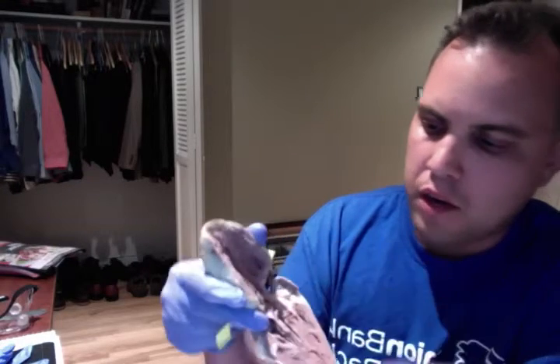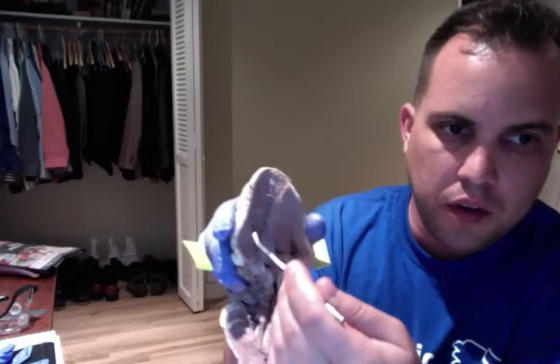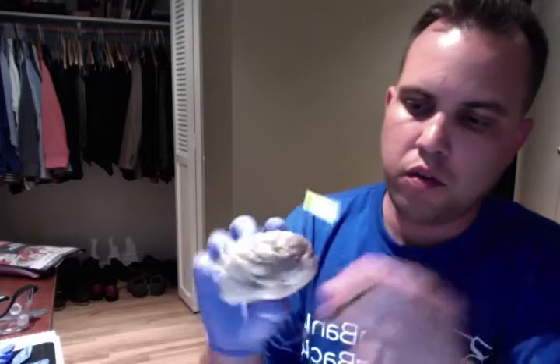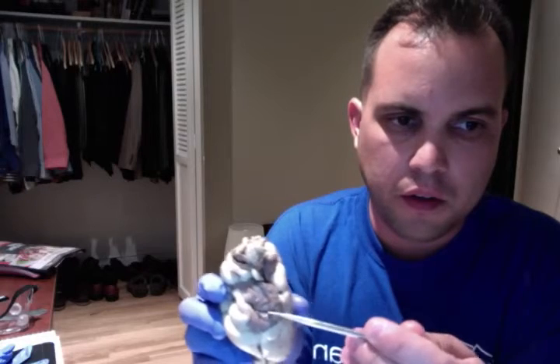And our myocardium. The myocardium is said to be pretty much most of the heart. You can see it all within the lining of the heart. If I were to close this up and look at the heart, you would see this, which is considered the base of the heart, and then this being our right auricle, somewhat like an ear-like leaf.